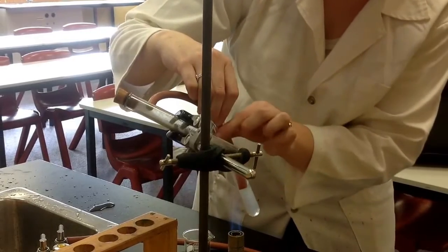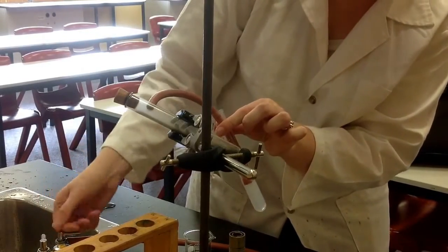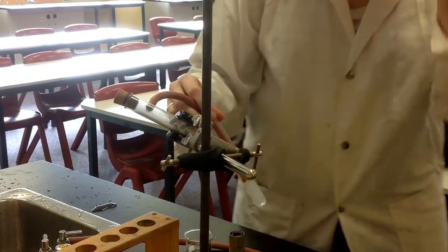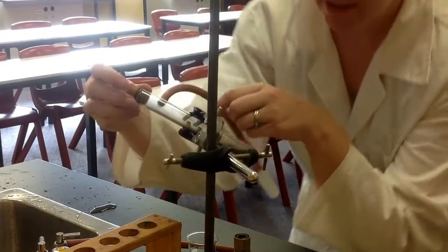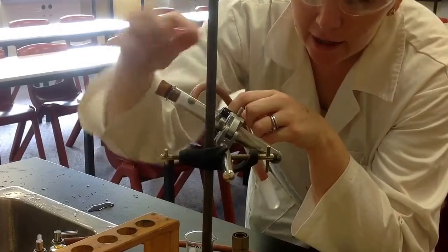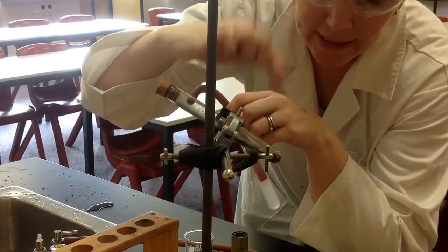Alright, so that's that practice. Quite easy, quite simple. Already you can see the two things that are happening here. The first thing that's happening here is my copper carbonate is no longer green, it's now black.